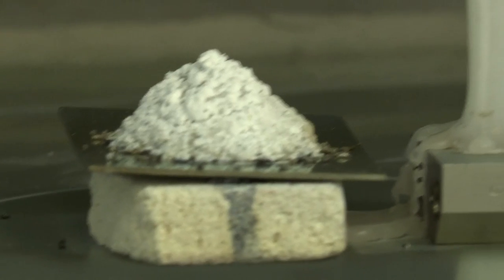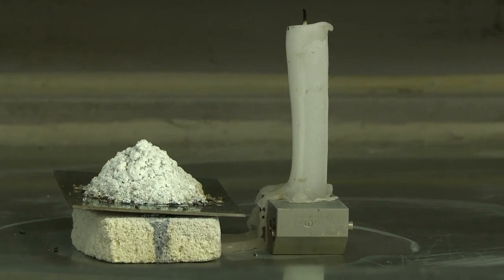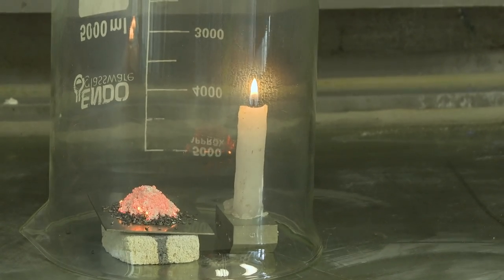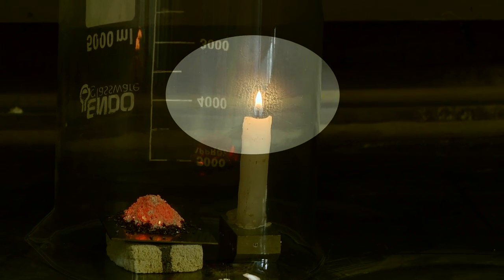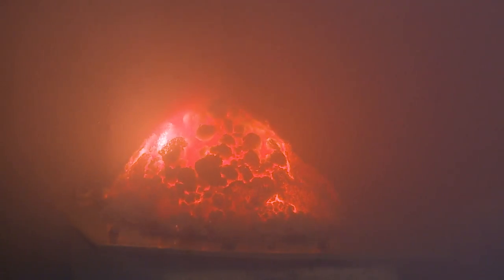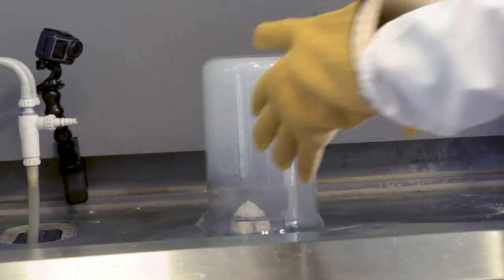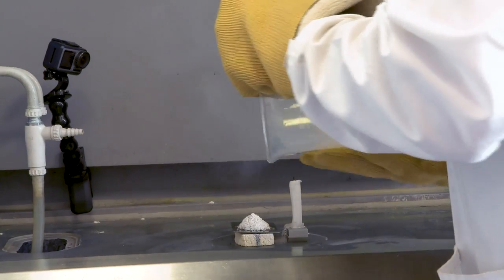The heat of the reaction melted one side of the candle, which was quite satisfying. But Neil, who often is cleverer than me, pointed out that this experiment was not perfect, because when the candle burnt it produced carbon dioxide and water vapour which accumulated inside the beaker — so we were potentially changing the chemistry as well. The one question we haven't answered is why did the beaker fill with white smoke. I think the answer is that the white smoke is actually very finely divided magnesium oxide — you see the same white smoke when you let off fireworks, which often contain magnesium and produce magnesium oxide.